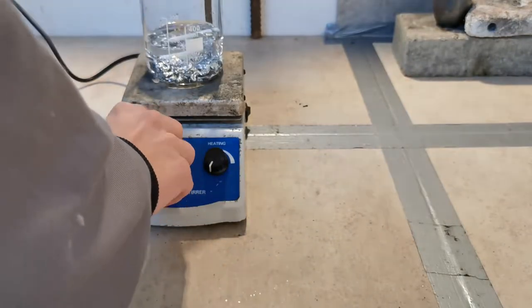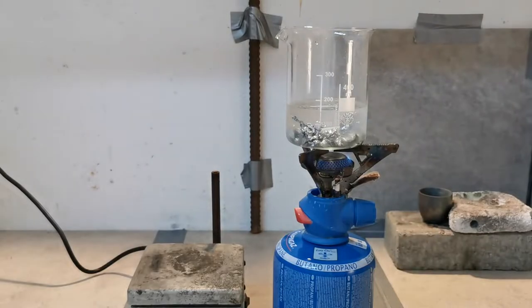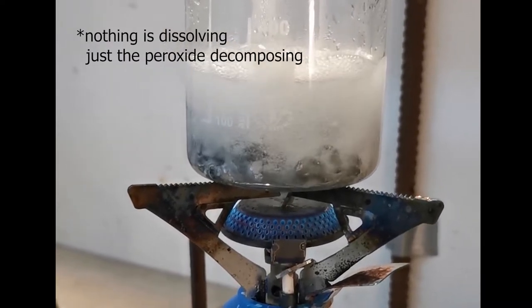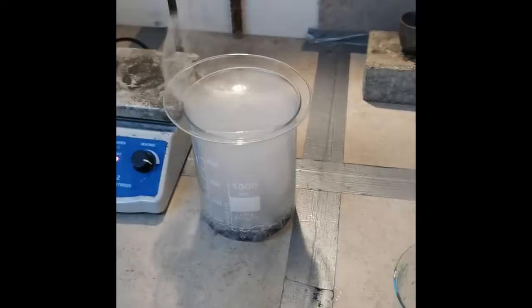But this took forever, even with boiling and some hydrogen peroxide, it didn't look like it was dissolving at all. So I decided to dissolve it in hydrochloric acid first and precipitate as the carbonate. This actually helps to clean it even further.